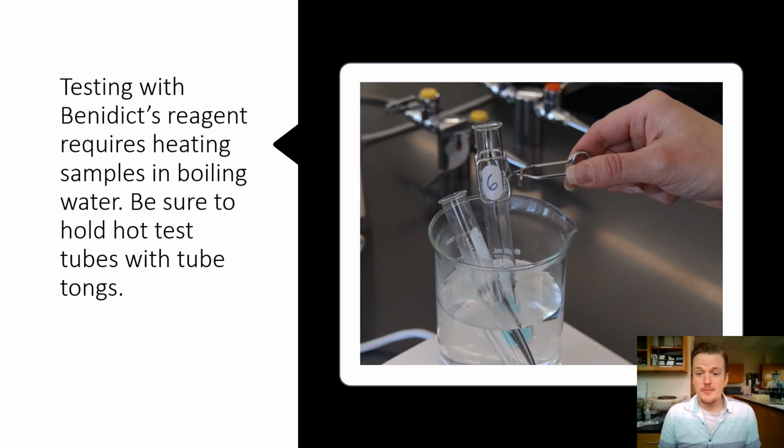As I mentioned, it's going to be hot, so you have to use the tongs to hold things. This sounds very straightforward, but when you're in the lab and actually running everything, it can get a little hectic, and it helps to have the reminders to actually use the lab safety that you will need.